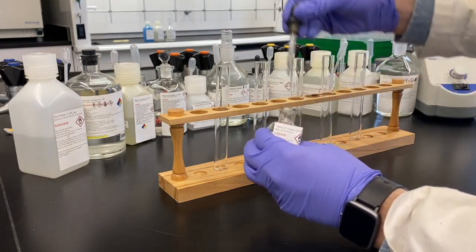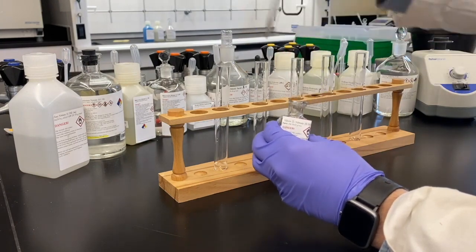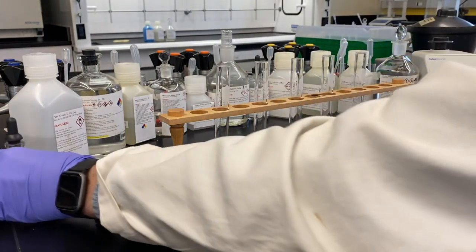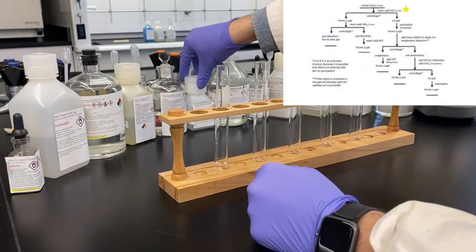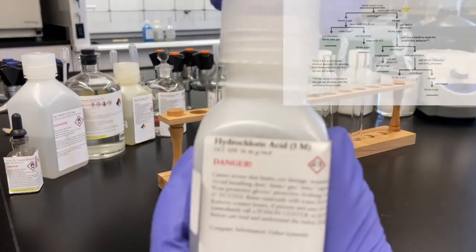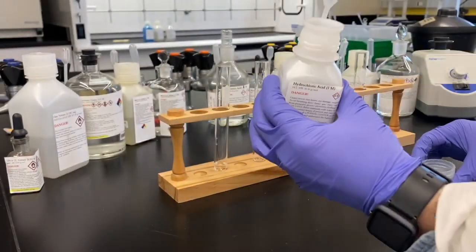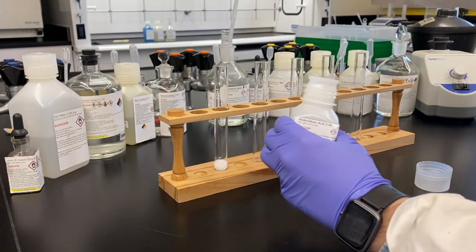So we're going to start off with our silver nitrate solution. We don't need that much. Again, this is a qualitative analysis. It's not quantitative. We're not measuring out by mass or volume any amounts. We're just seeing how things react down the tree. So with our first unknown, our first addition down the tree will be hydrochloric acid.